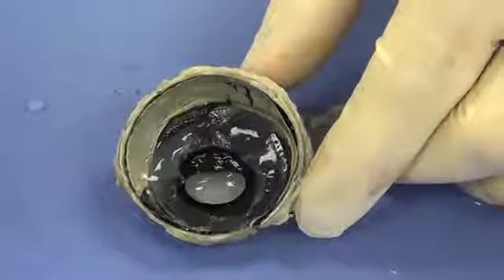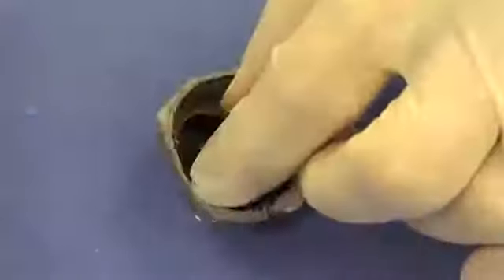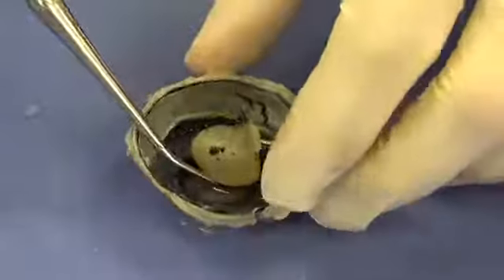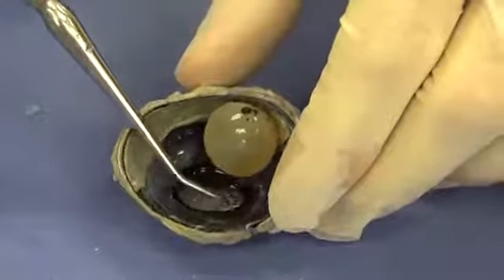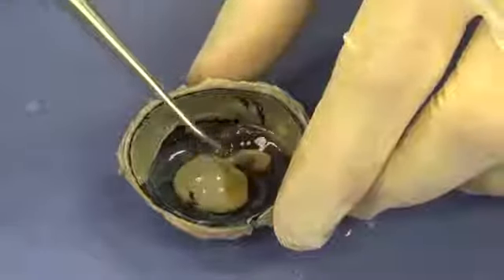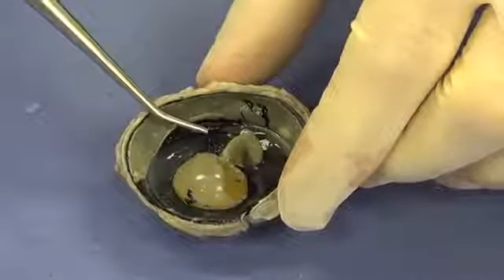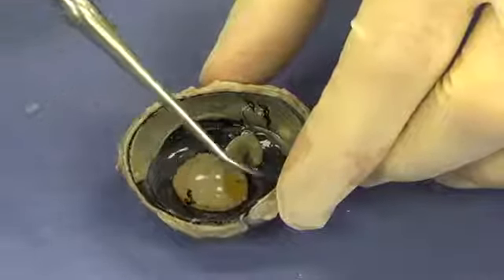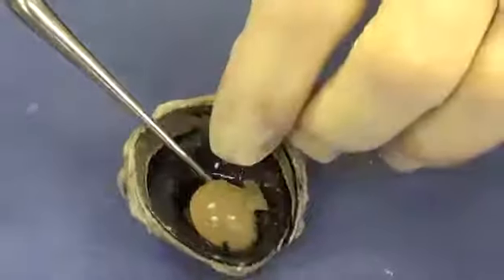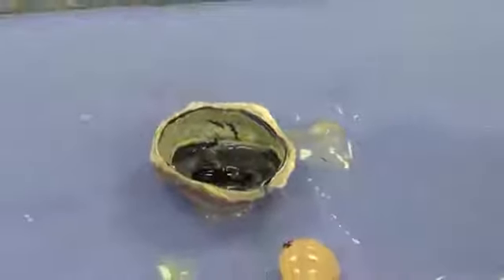Now I want to go over one more thing, and that was if I take the lens and I replace the lens back in the eye, anything anterior to the lens, meaning where my probe is located, is referred to as the anterior cavity. Anything posterior, where my probe is located now, is called the posterior cavity. The vitreous humor is in the posterior cavity. And that's going to be it for the cow eye dissection.